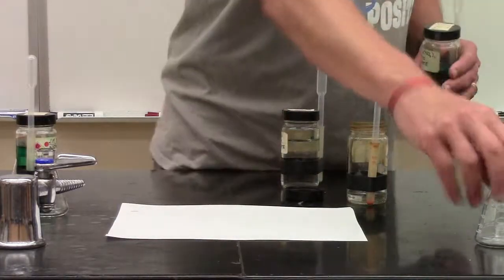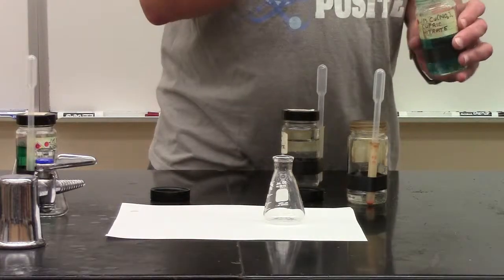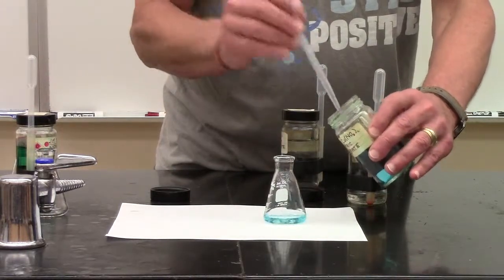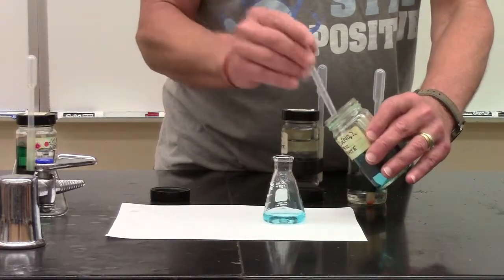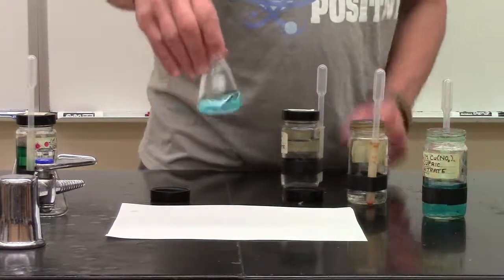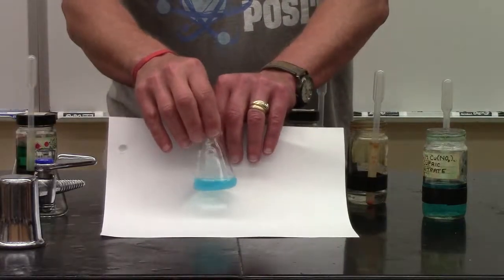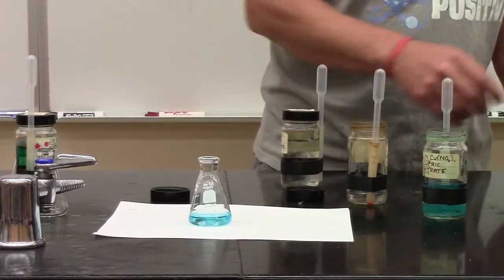And my last color change for today is I have some copper nitrate, copper(II) nitrate. And again, you can see this is a blue color. That's very common for copper in solution to be blue. Okay, we have a nice blue color. And if you go to a lake near a copper mine, it'll be a beautiful blue, but it's not because it's clean, it's because it's full of copper, which is fairly toxic to most.